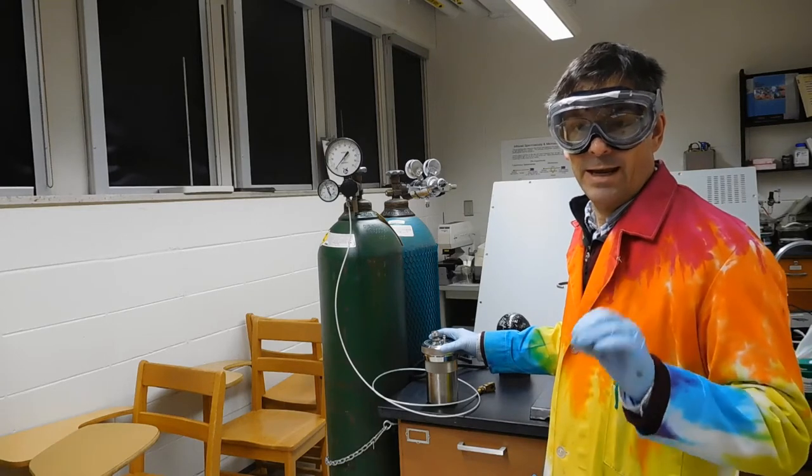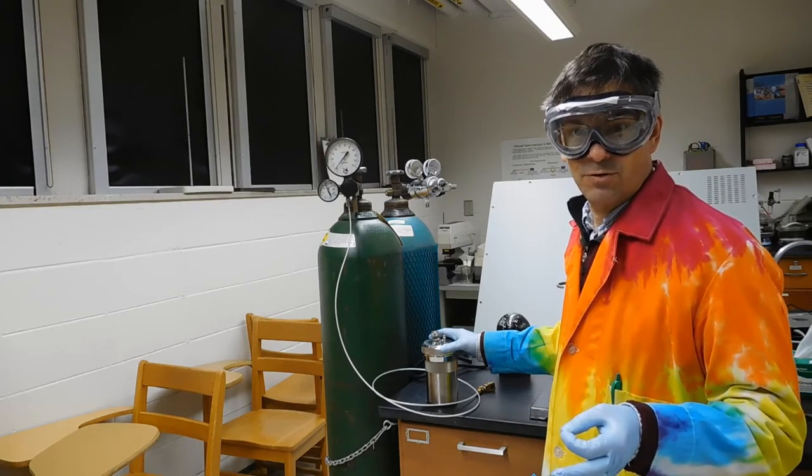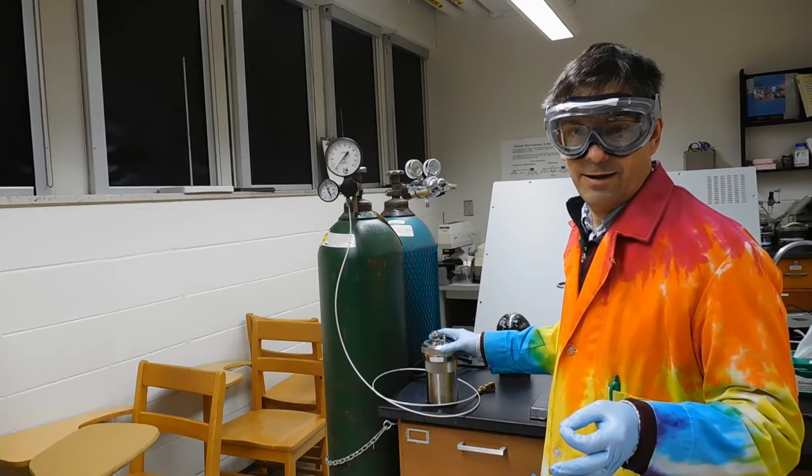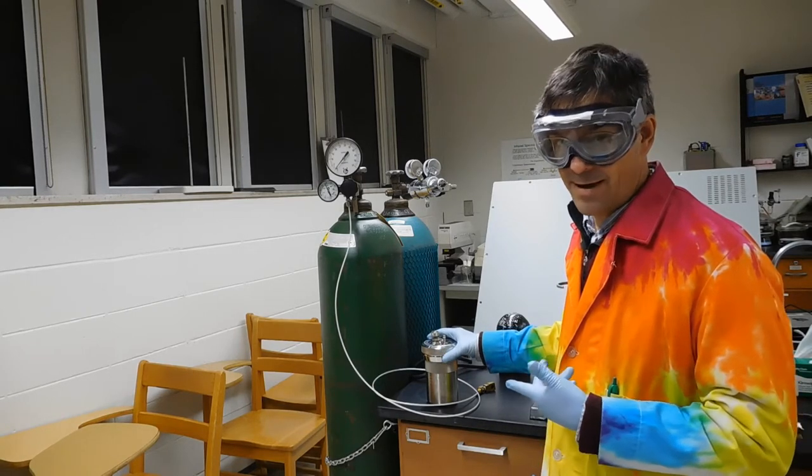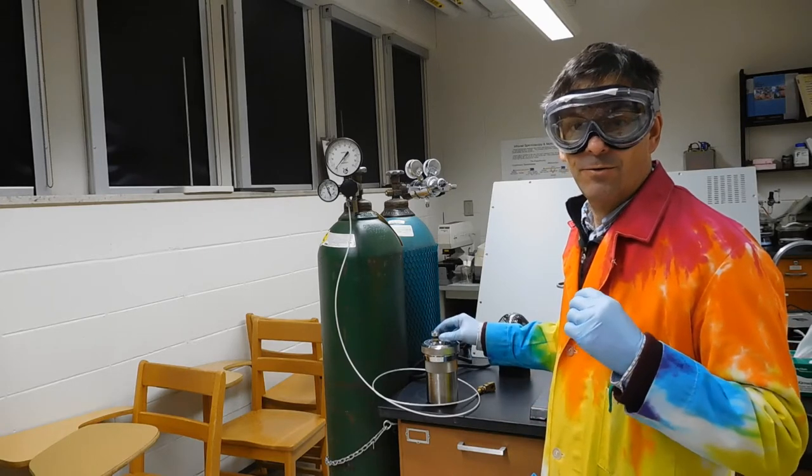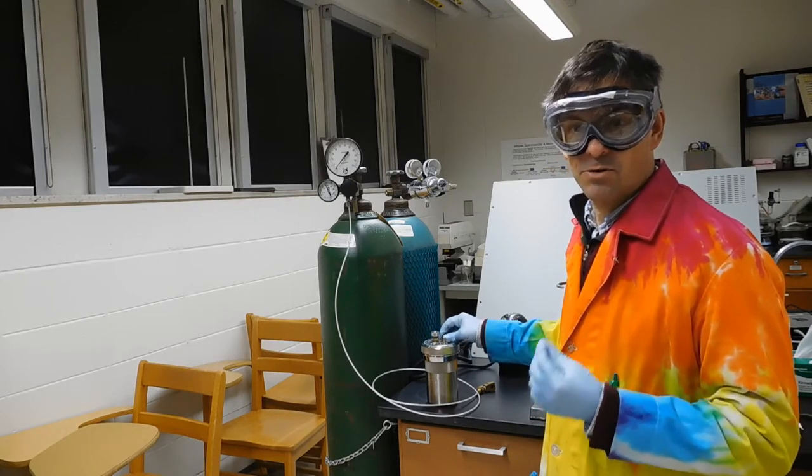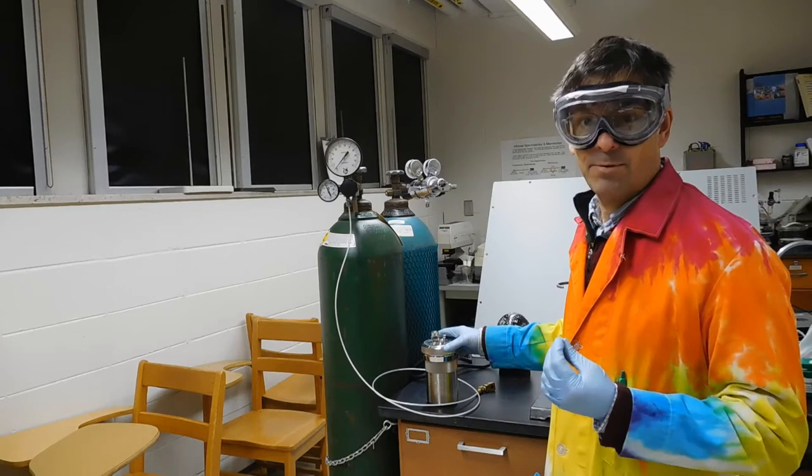In the last video, we put the fuse wire on our sample and then closed up the bomb here. Now, for the bomb calorimeter to work well, you need your sample to burn completely.